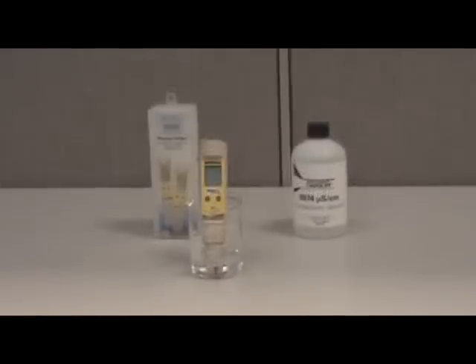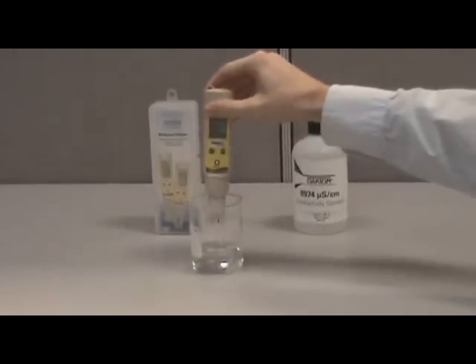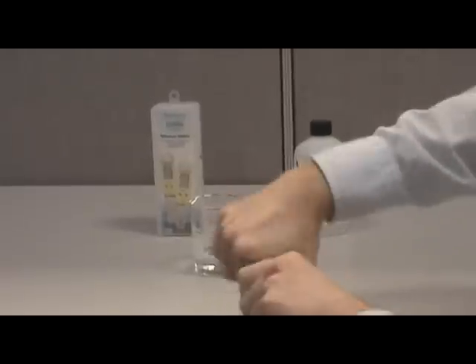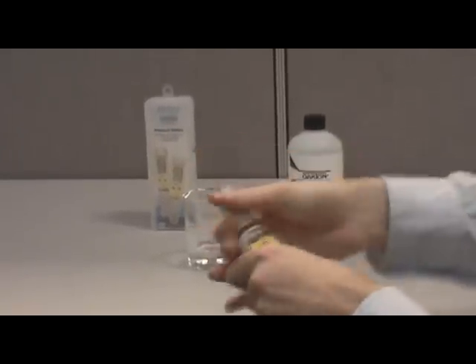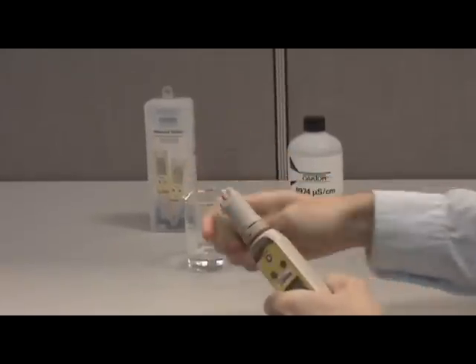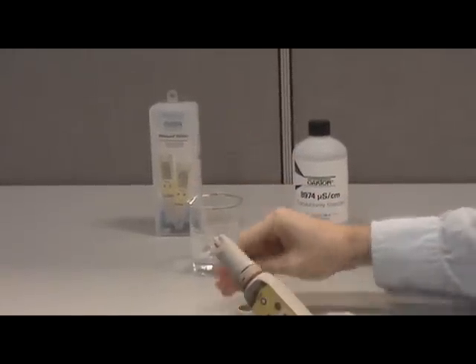Over time, the sensor may require replacement. If the tester will not calibrate or shows unstable readings, you may need to replace the sensor. To do this, unscrew the collar where the sensor attaches to the tester body using a counterclockwise motion. Remove the collar, ensuring you retain the two O-rings.